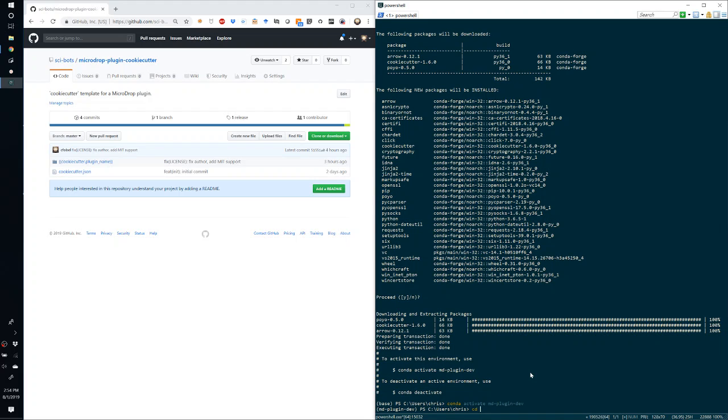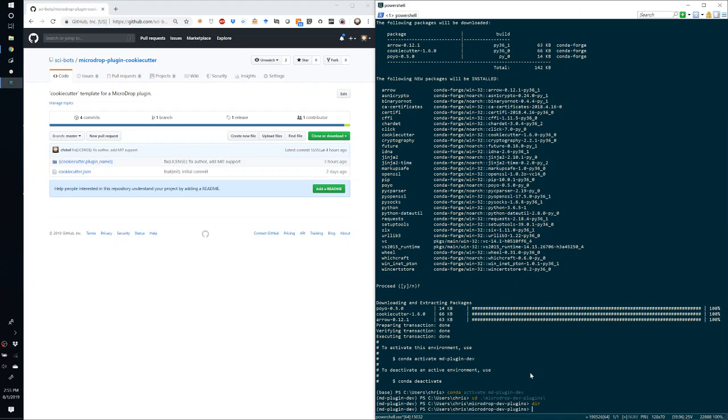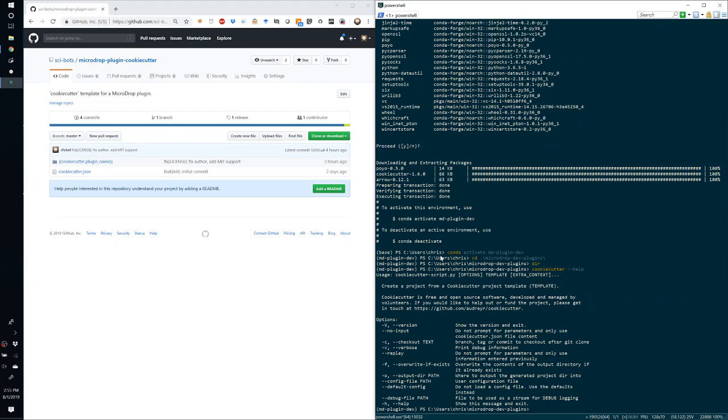And now change into the directory that you created, microdrop-dev-plugins. Okay, now we've installed cookiecutter, so I'll use help to show some of the options that we can specify here. But the main thing is we specify a template to render, and then it will prompt us for some values to fill in.